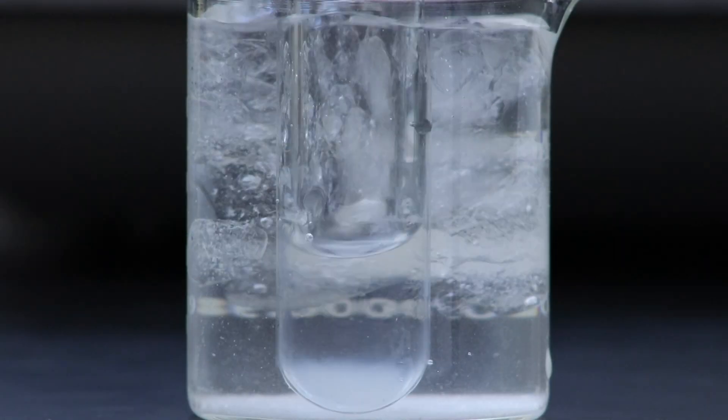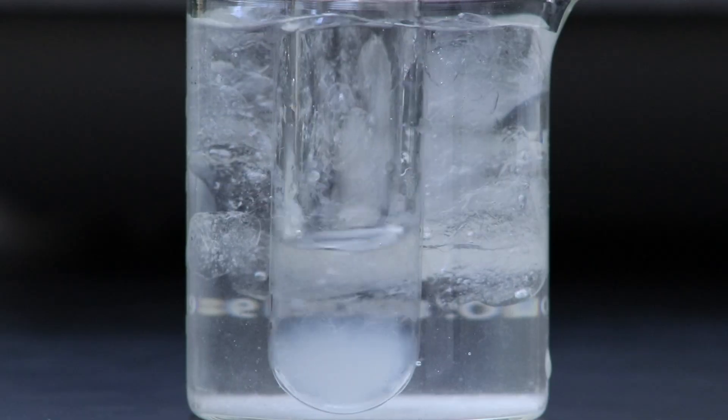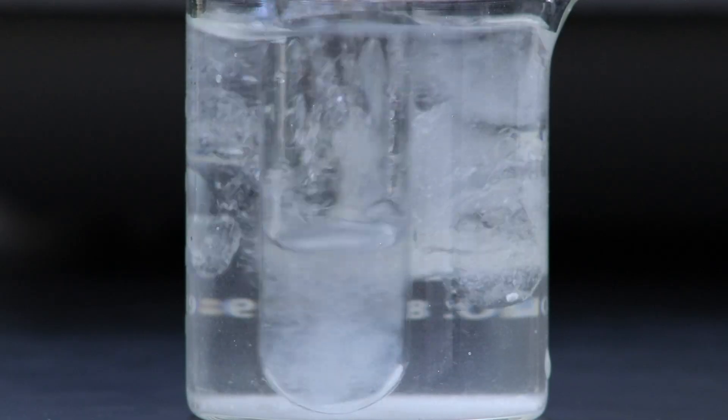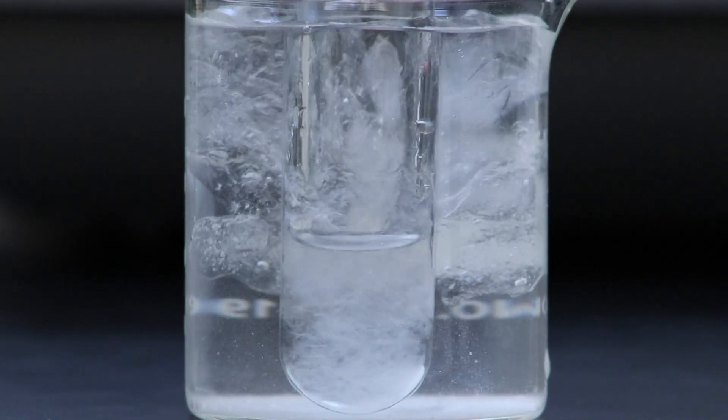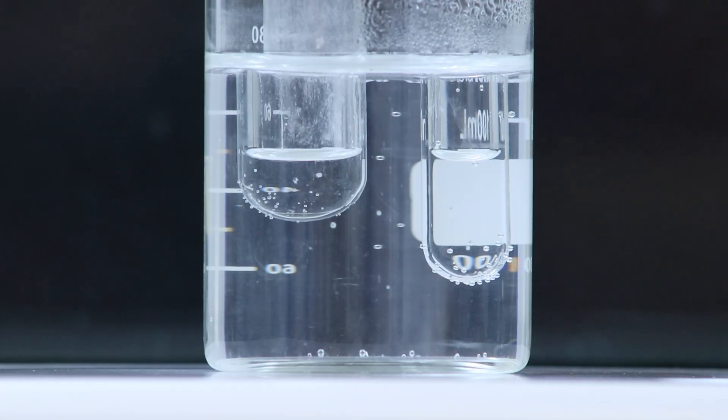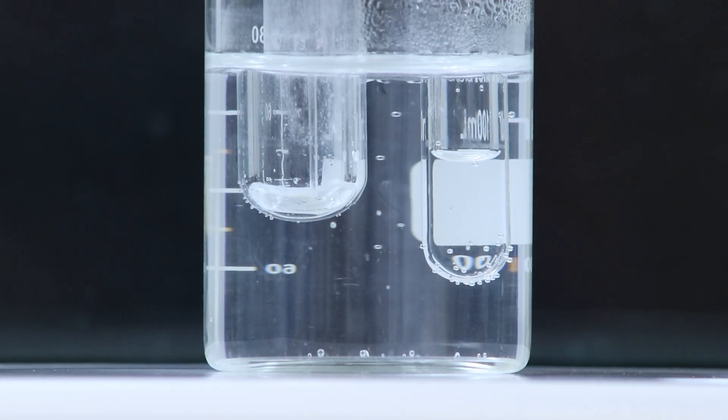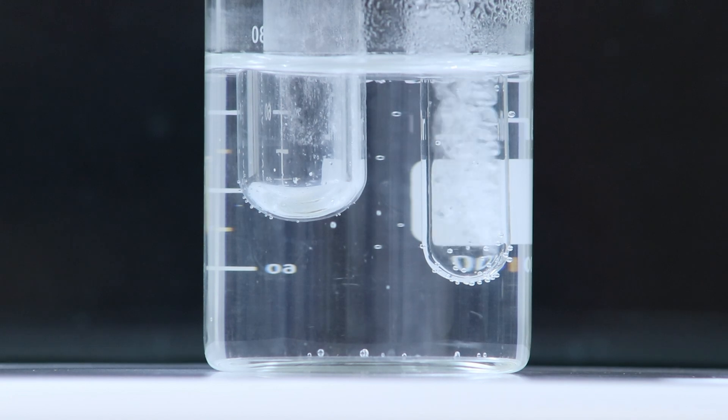I'll check that the product can come out of solution in an ice bath, which is looking like it definitely can. So I'll transfer it back to the Craig tube in a hot water bath so that we can continue the recrystallization process.